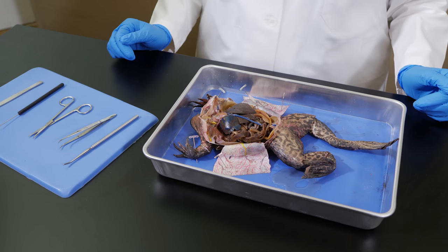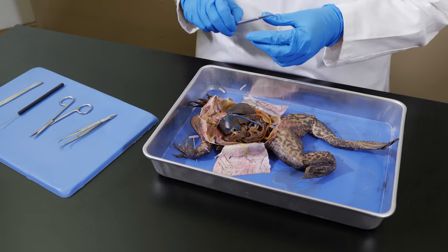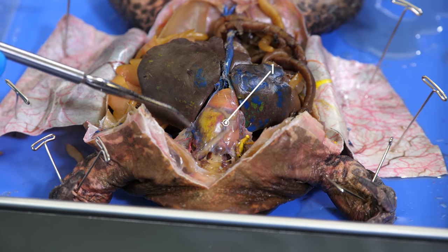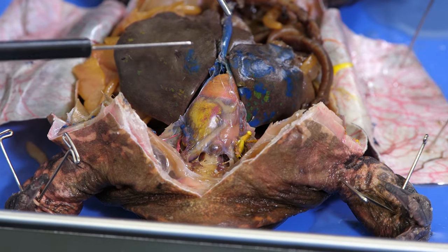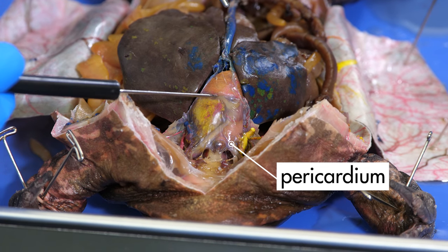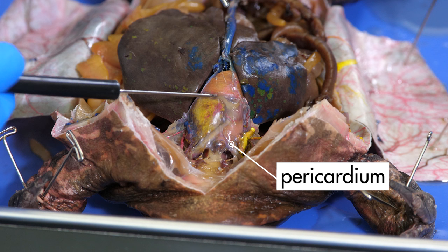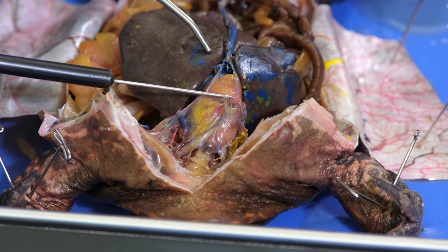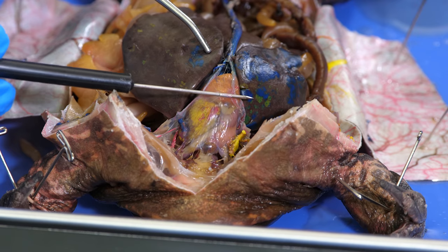Now, let's look at the frog's circulatory system. The primary organ of the circulatory system is the heart. The heart is enclosed in a tough, clear membrane called the pericardium. The pericardium protects and cushions the heart.